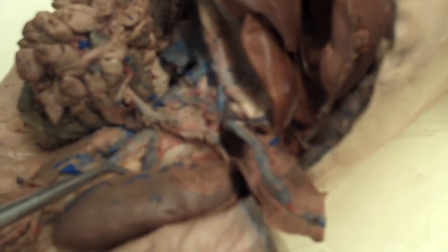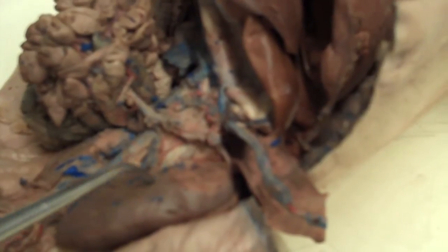Moving caudally further, we'll get to the renal artery. This is the left kidney.